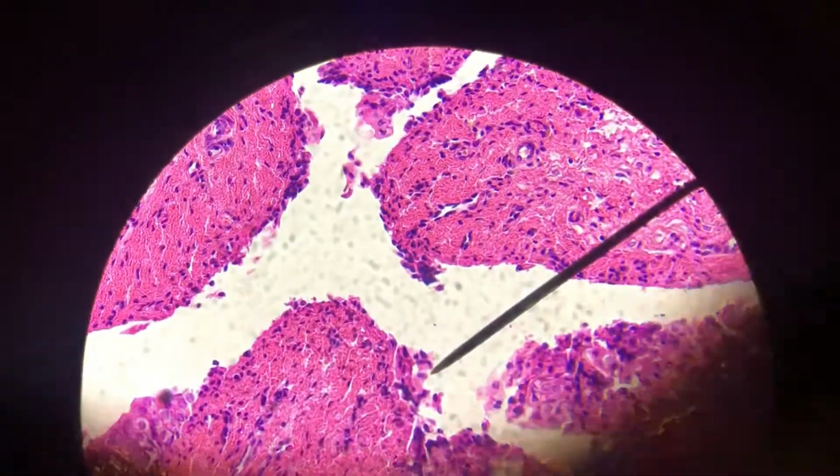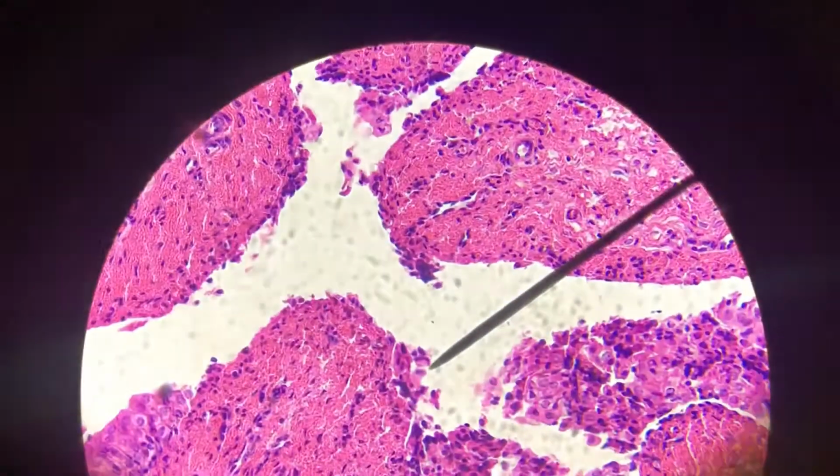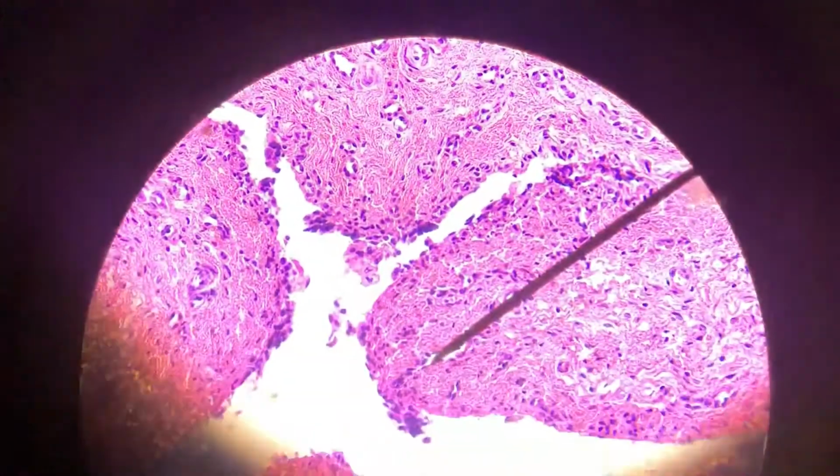Let me see if I can find another spot. Just work with me here.